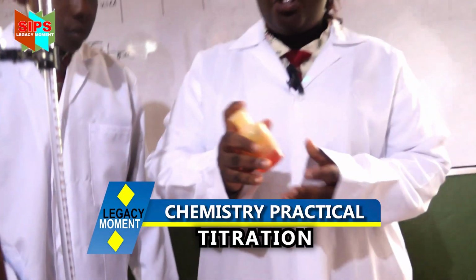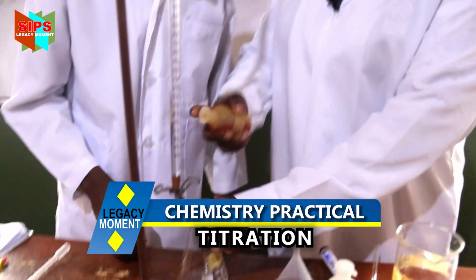Then we add 2 to 3 drops of the methyl orange, which is our indicator.